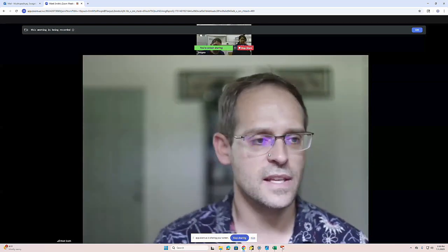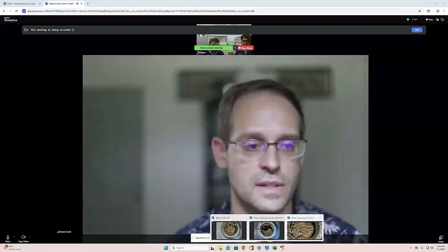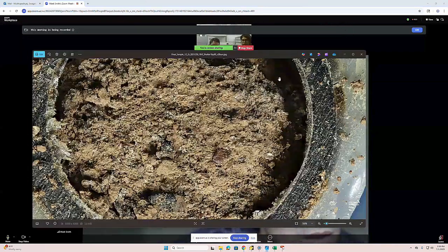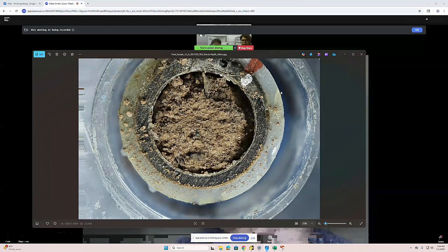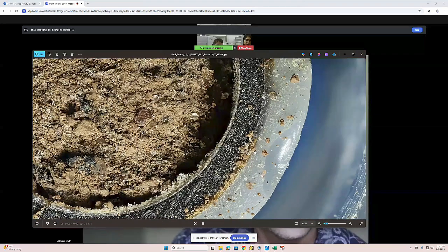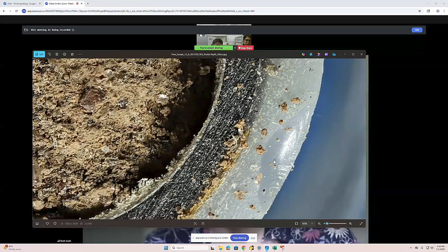The next thing is if we go back to that photo you were just sharing, the information on the top, not the soil itself. I'm curious, I don't know how magnified you are, but if you look at the epoxy around the dirt, this is the epoxy he's talking about right here. Can you zoom in? That epoxy looks clear until you get to that point, then it starts looking pretty poor, and that's at 100%. So you should definitely be sharper than this, much sharper.